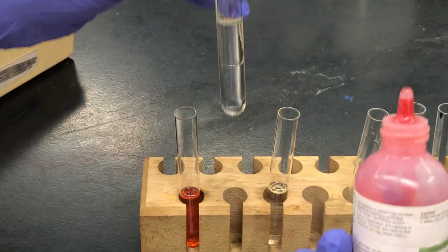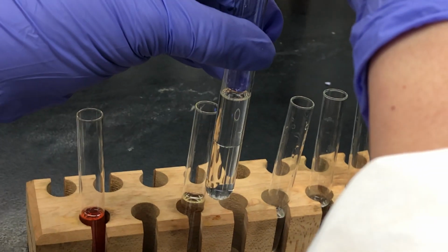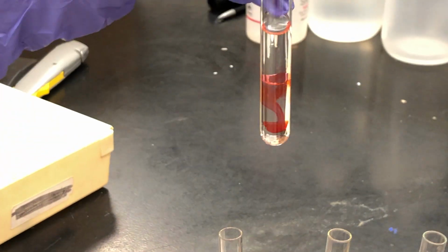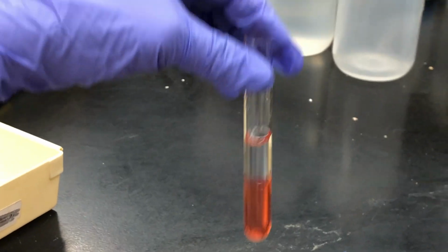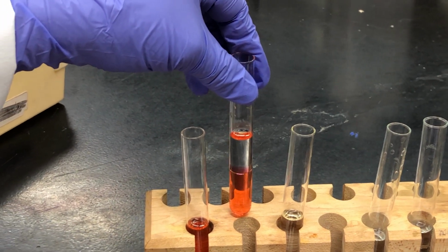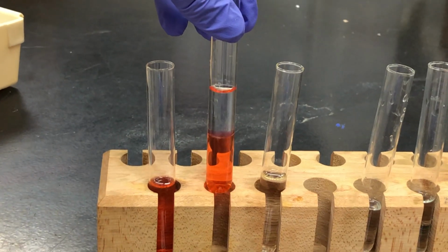The second one is water and pentane. They don't mix, but that's going to be a lot easier to see with the food coloring. We have the food coloring there. We're going to do a little bit of shaking, trying to mix them, but you can see that they don't mix at all. Of course, pentane and water are very different. Water is very polar, pentane is not polar at all. And so they don't mix, and you see the two phases, the two liquids don't mix at all.